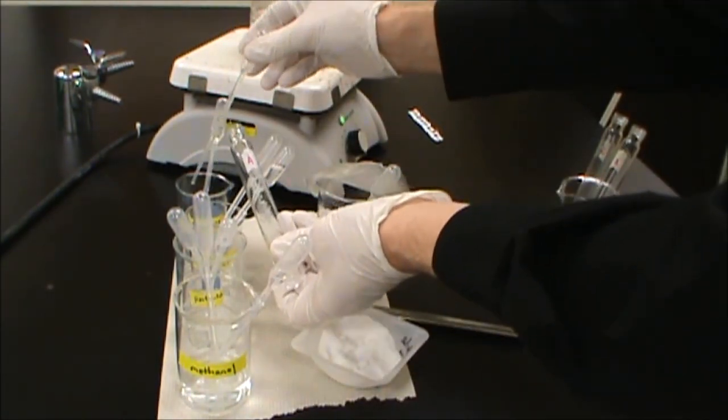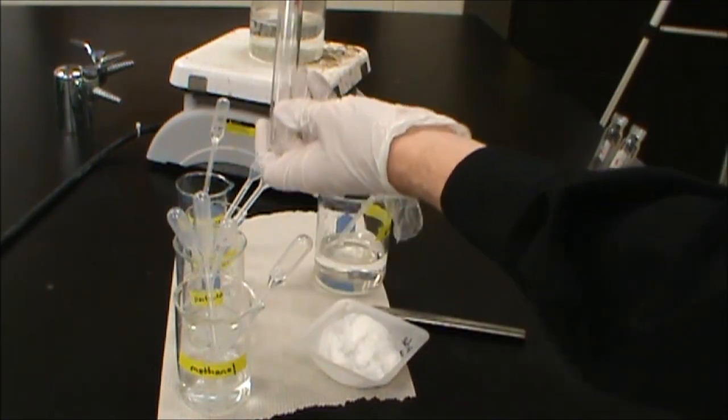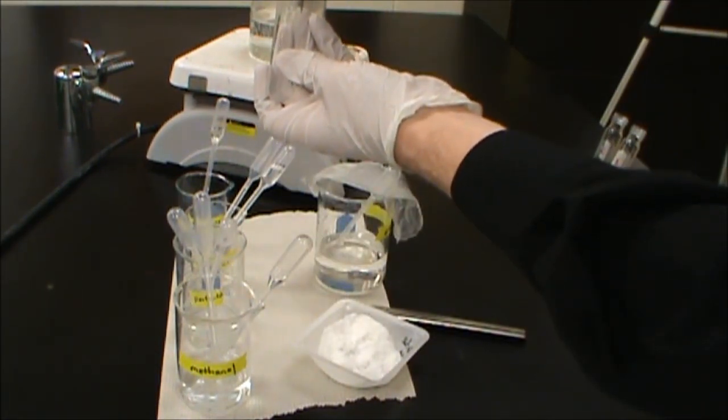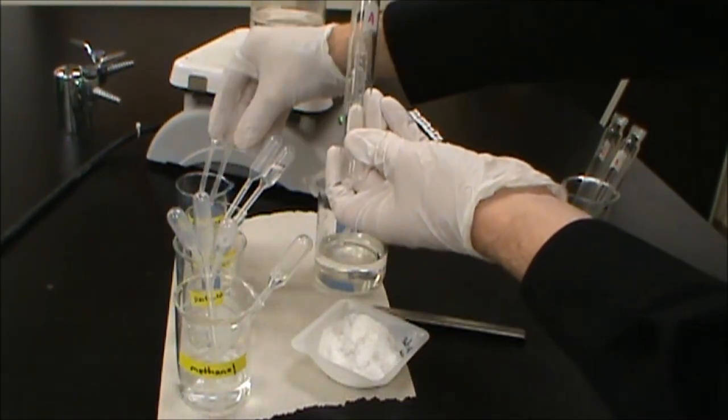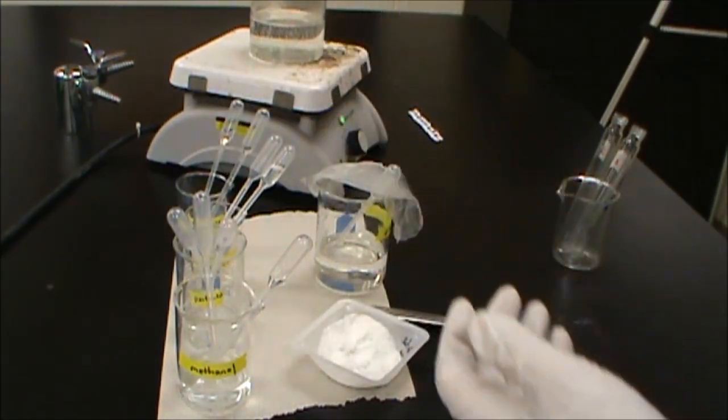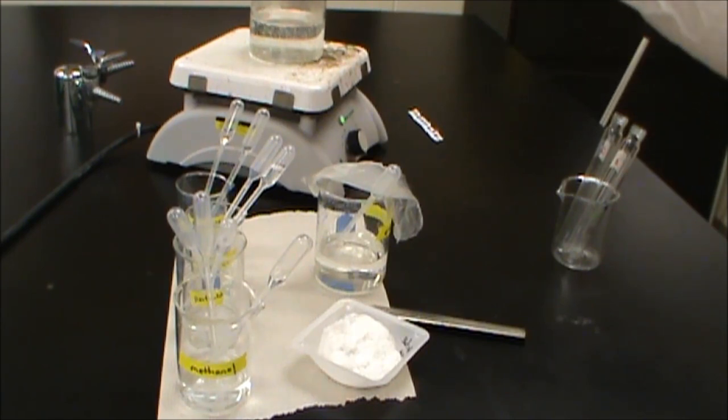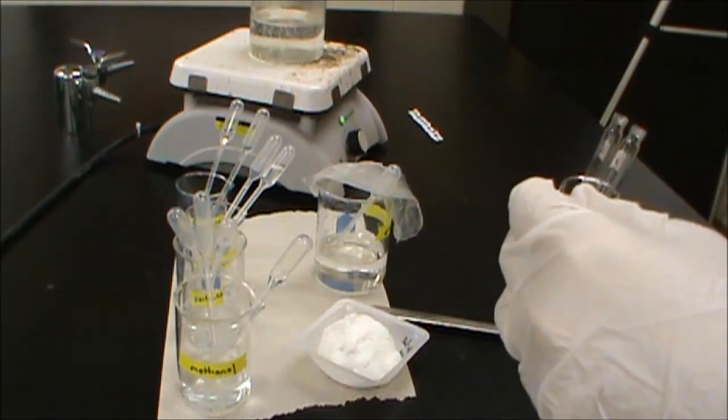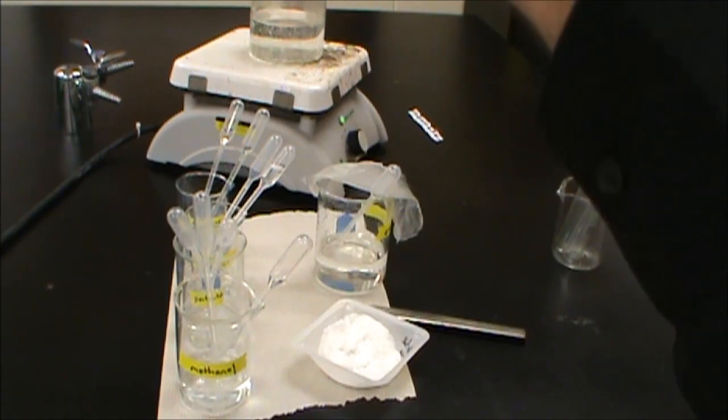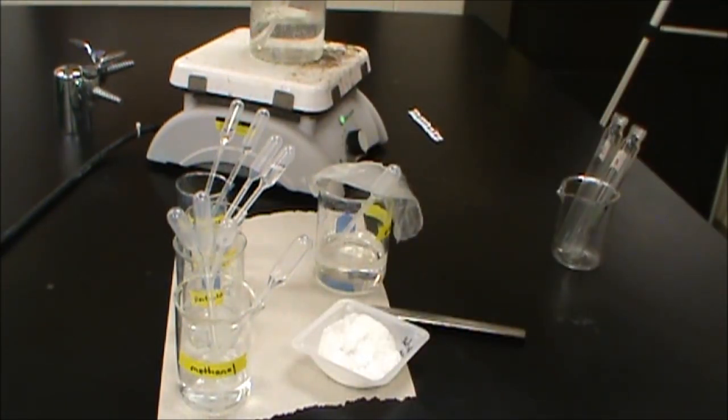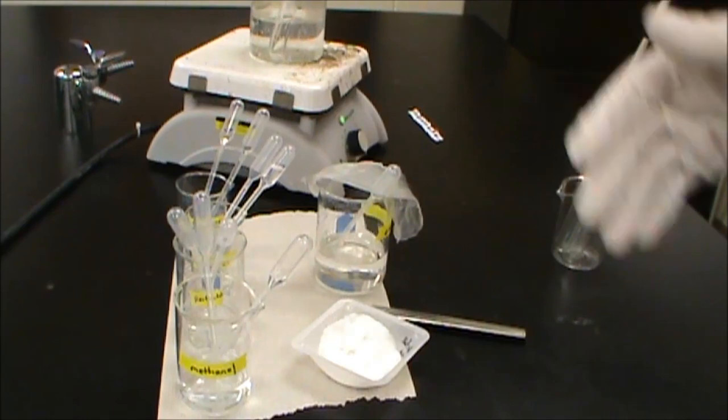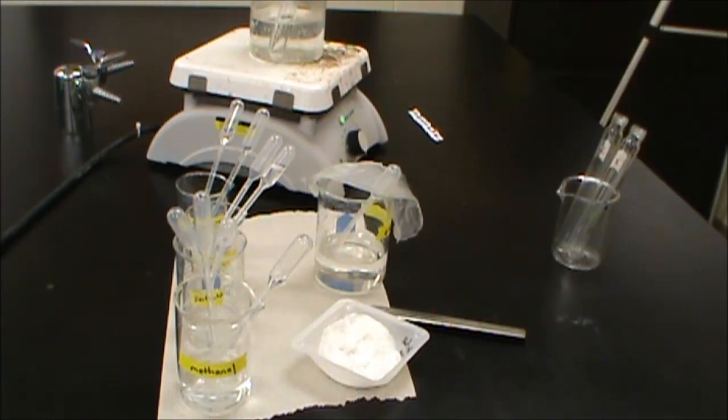I'm going to go really close so we don't spill that anywhere. And one, and two. It looks like we want to get that down in there. All right, so we're going to try and get some of the stuff off the sides there, and down in the bottom. We're going to stick that into our hot water bath. And we need that to sit in there for about five minutes.